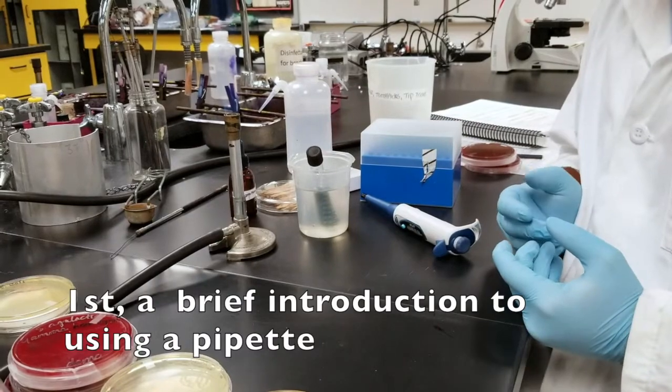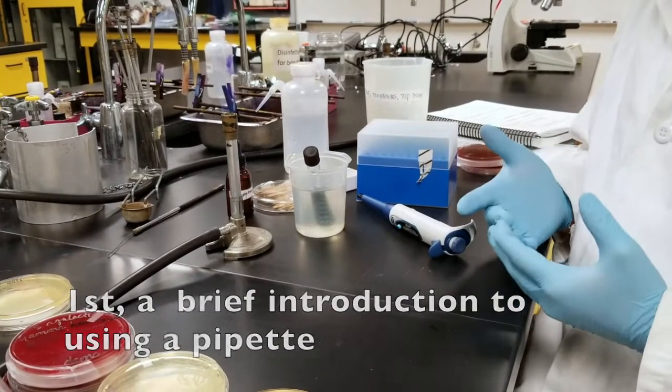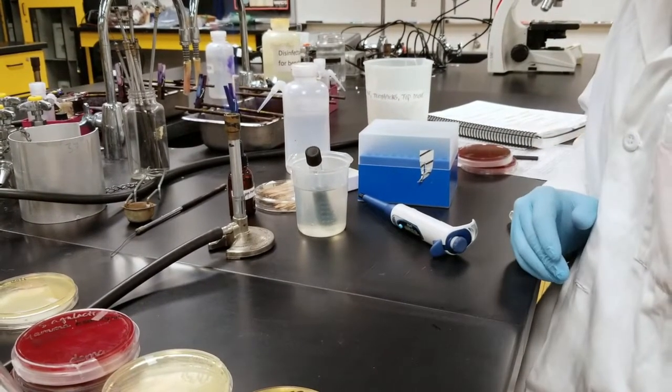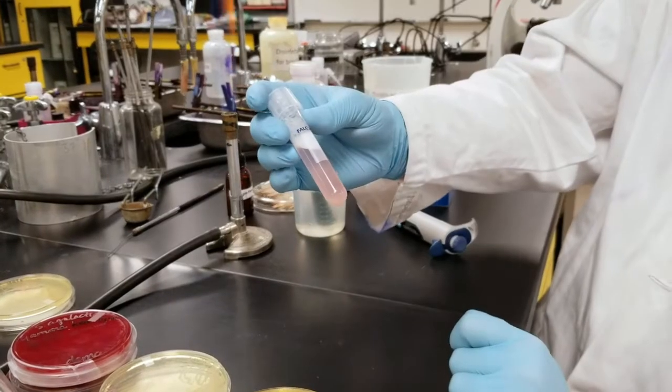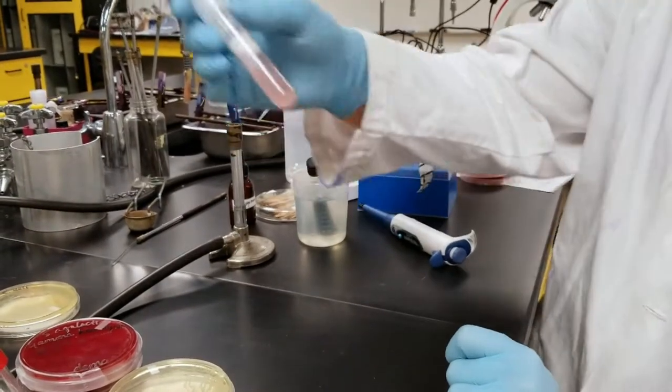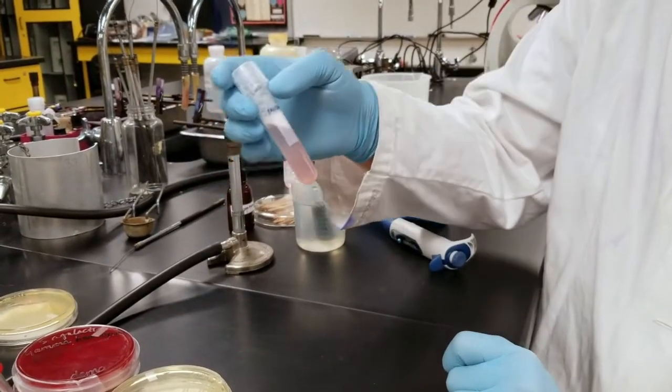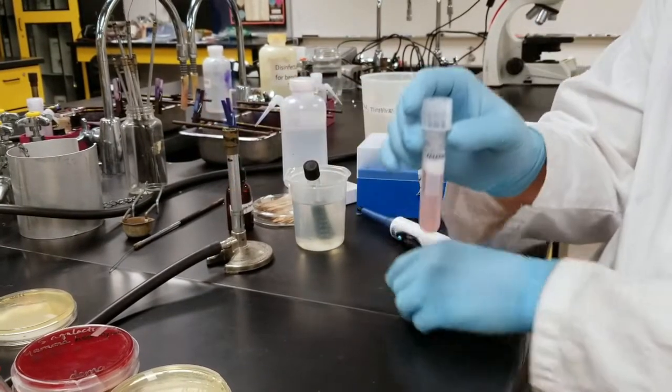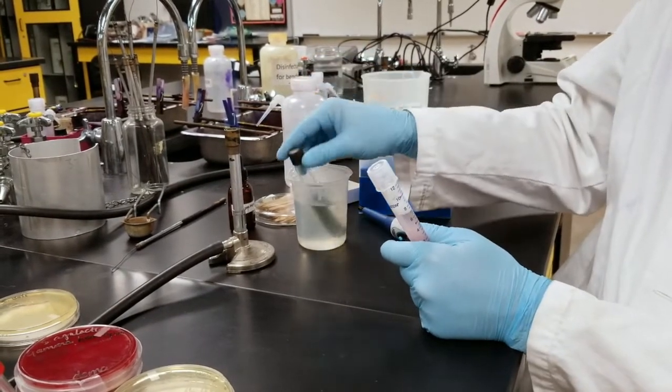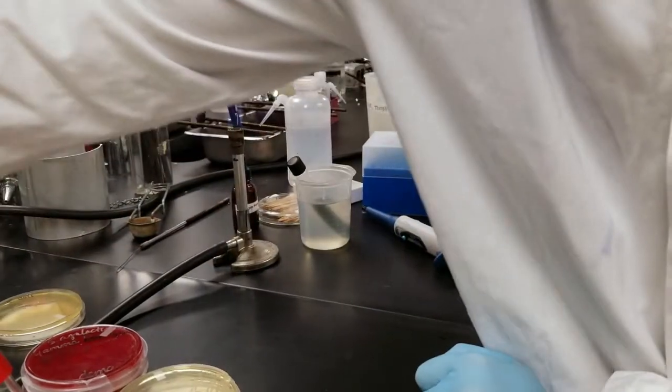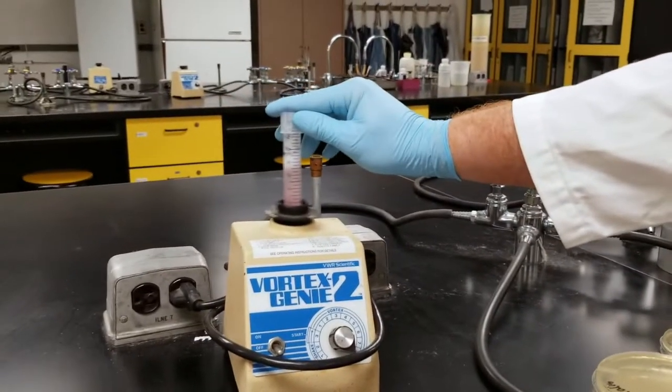All right, so now what we're going to do is our Snyder test. In this tube, I have a collection of spit. Before I apply my 200 microliters to my heated Snyder broth, I'm going to vortex it to mix it up.